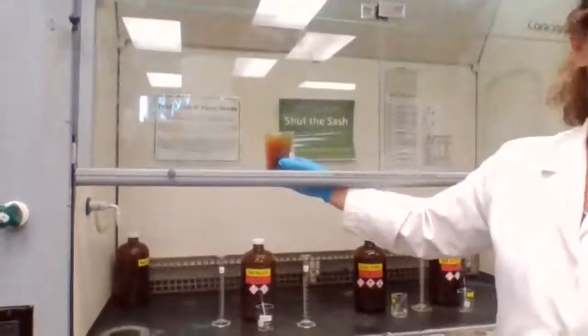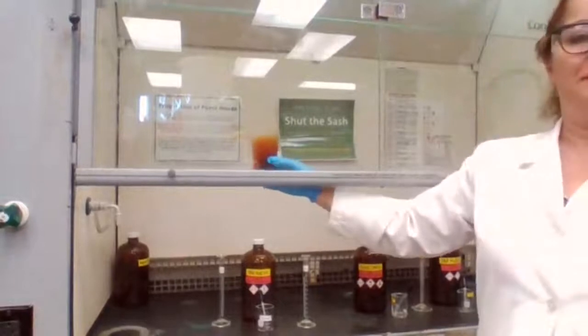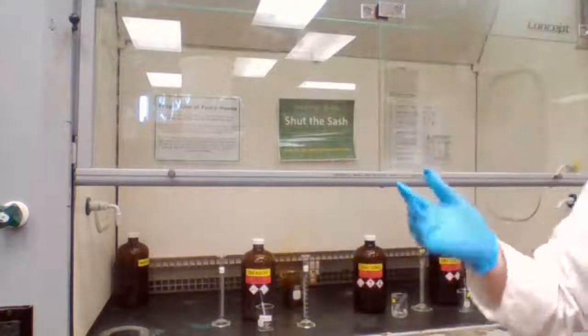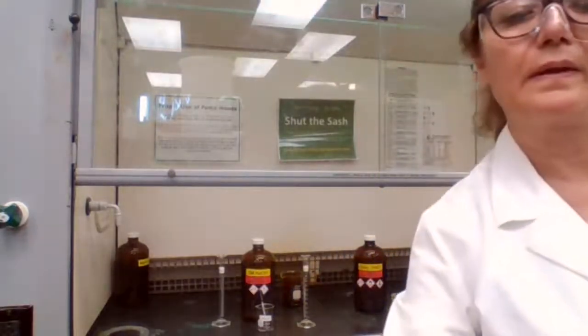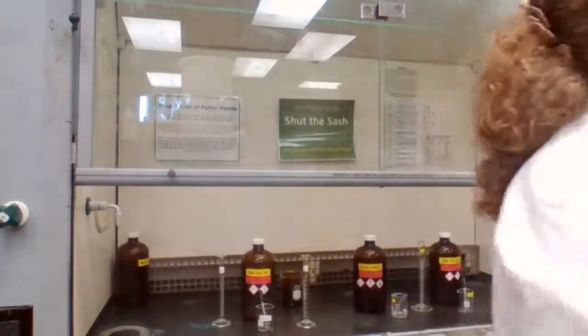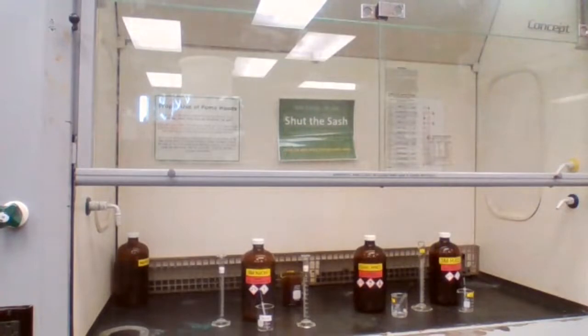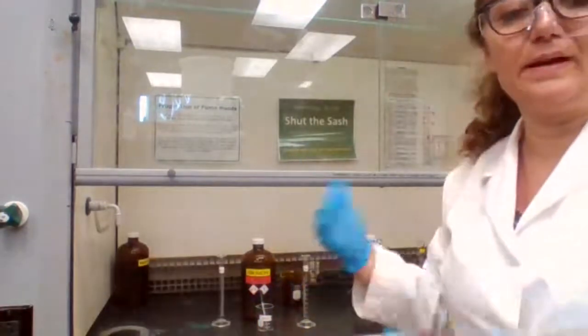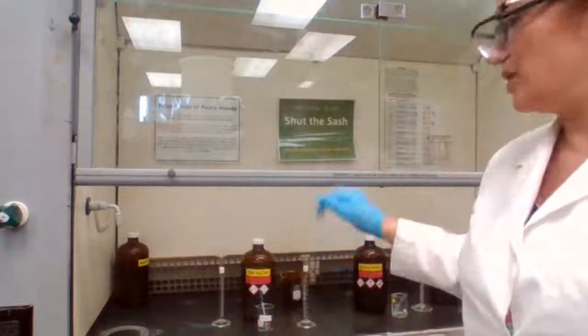It's very toxic. And you should be happy that you're not here to inhale this fume, because the fume hood is not on. I'm giving some time for the fume to go away, and then I come back to add the water. So also copper needs to dissolve.